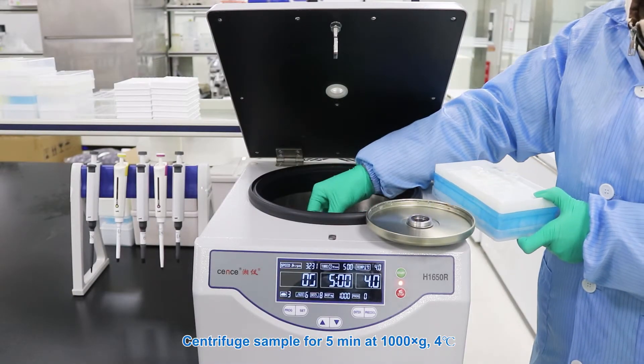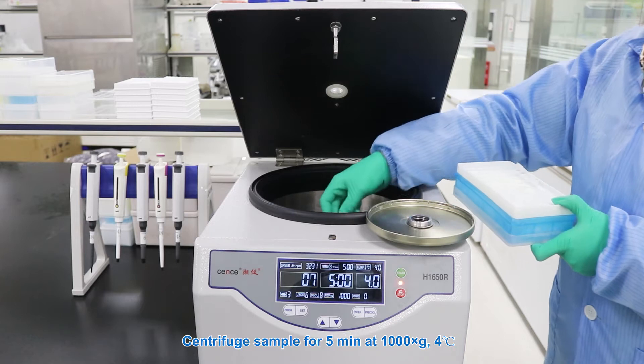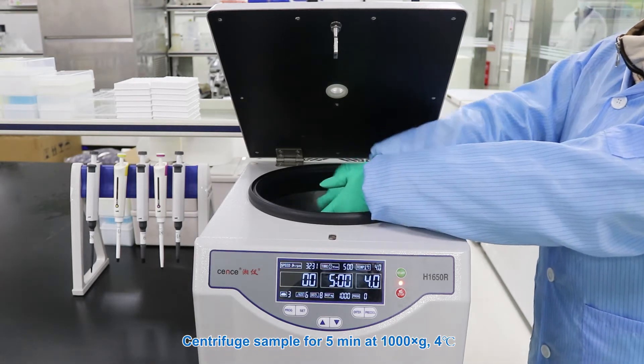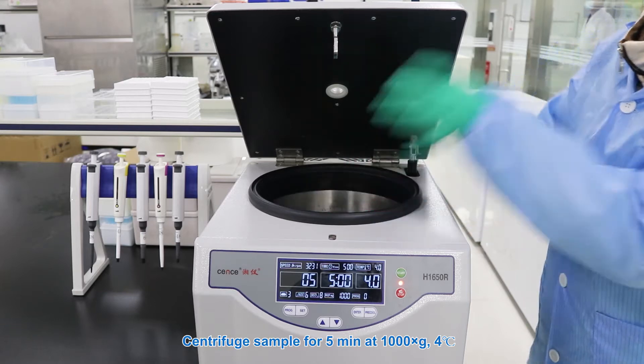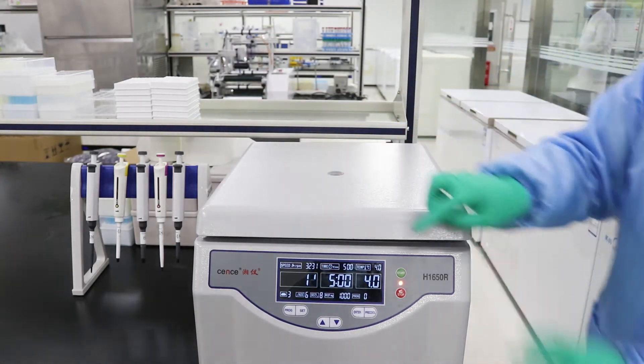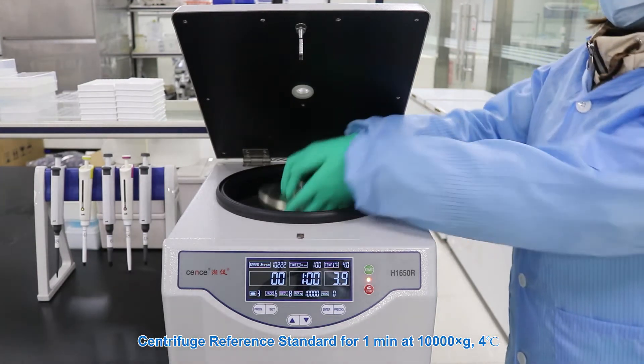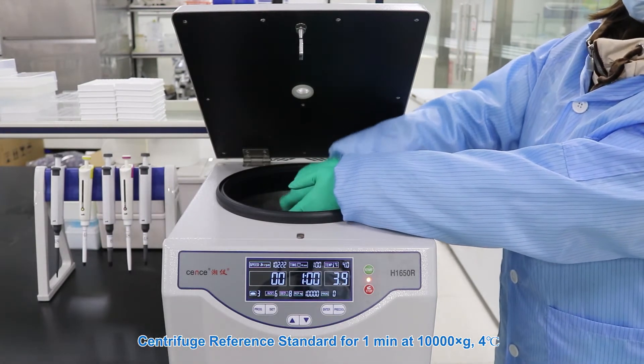Centrifuge sample for 5 minutes at 1000 G, 4 degrees Celsius. Centrifuge reference standard for 1 minute at 10000 G, 4 degrees Celsius.